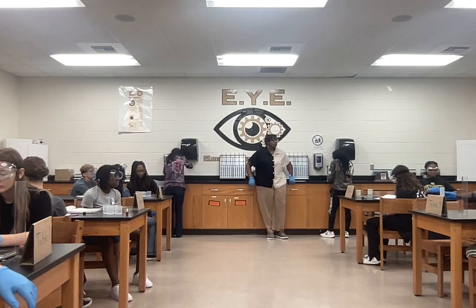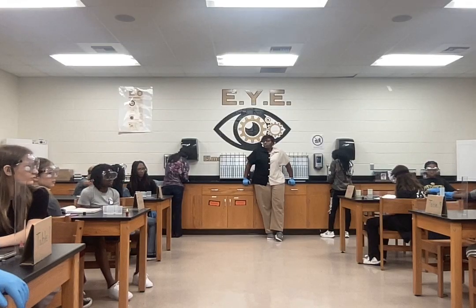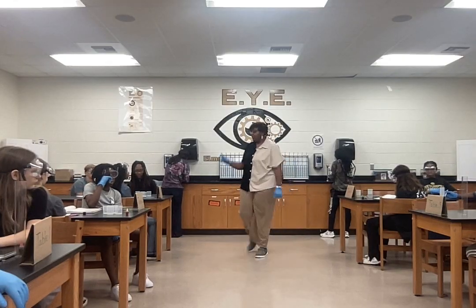All right, somebody, why are some of y'all wearing goggles and some are not? Raise your hand. Haley? They got on glasses. Because they have on glasses already. Good.